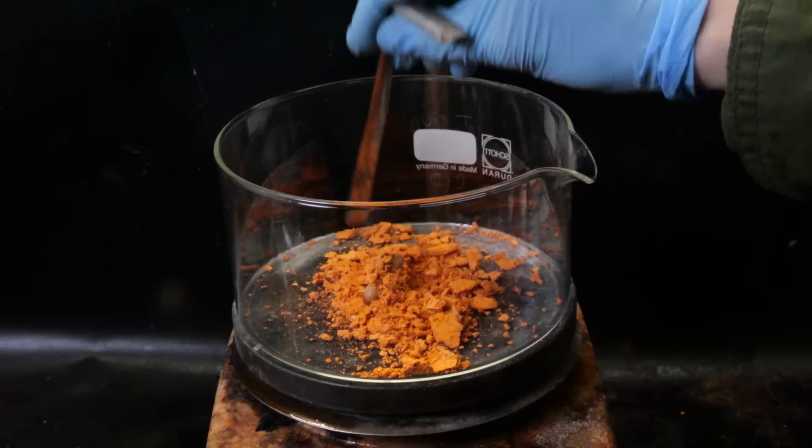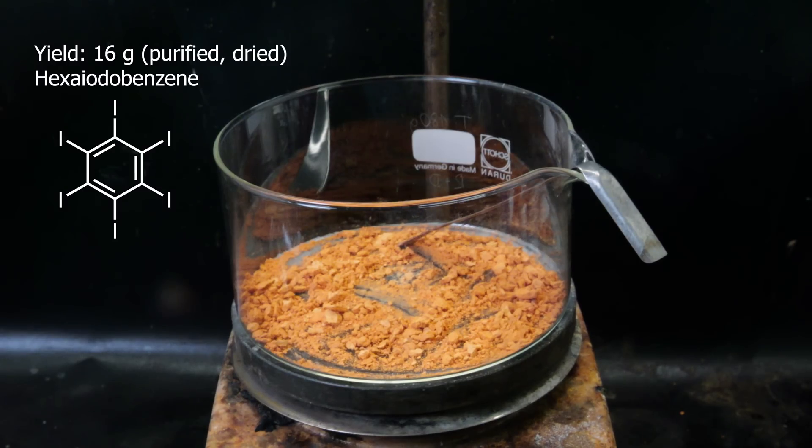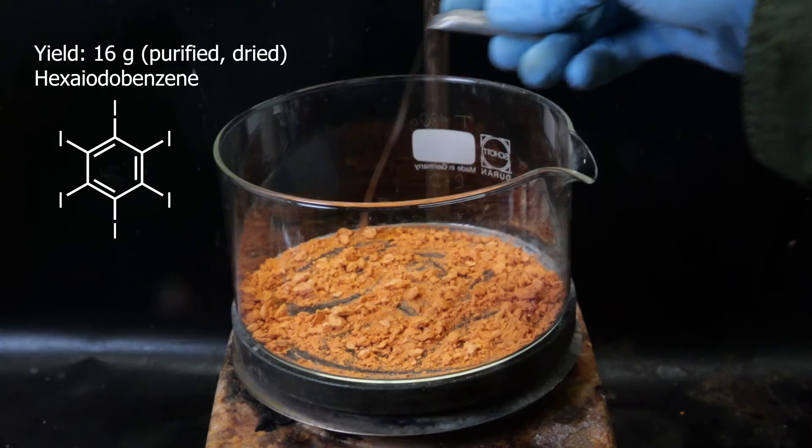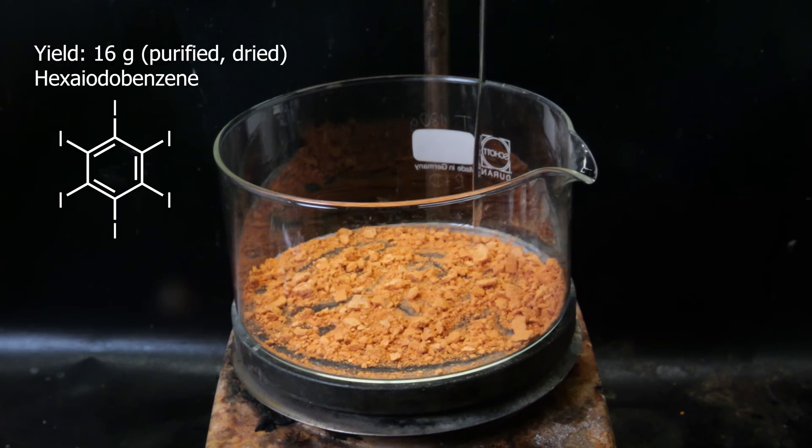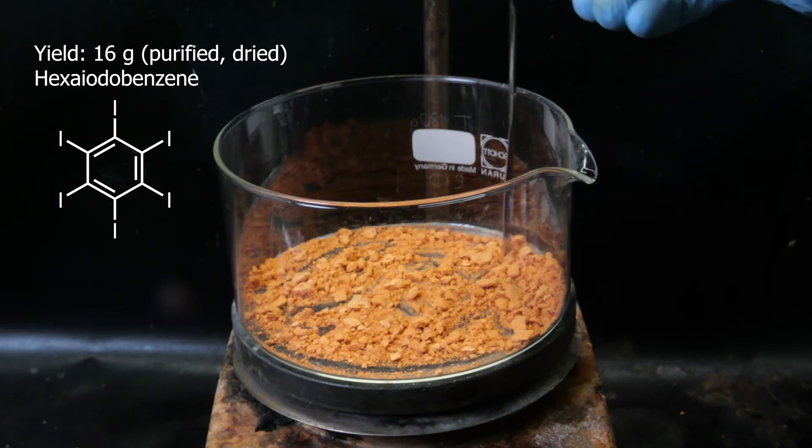I move it all to a dish at 100C, and the dry weight turned out to be 16 grams. So about 1 gram of impurity was destroyed in this process. Other than it being able to survive piranha and a nuclear weapon, it is a very uninteresting compound because it doesn't do anything.